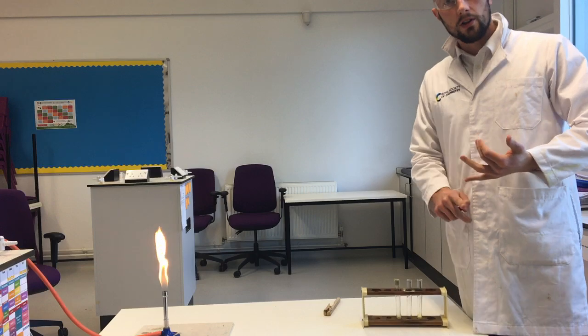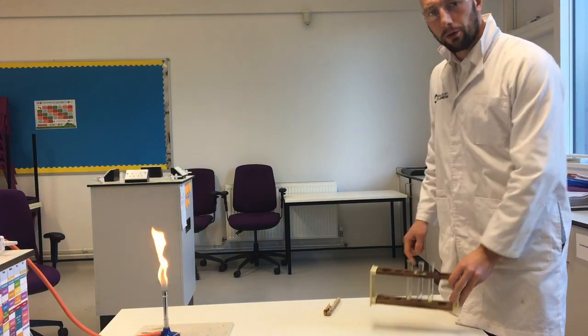Today we're going to look at some elements, compounds and mixtures. We've got three things to show you. I'm going to come up close to the camera.